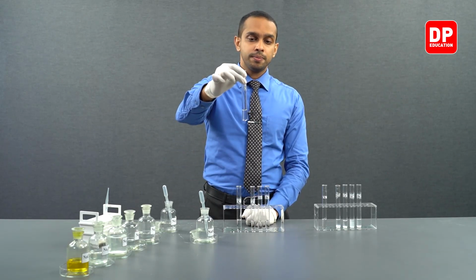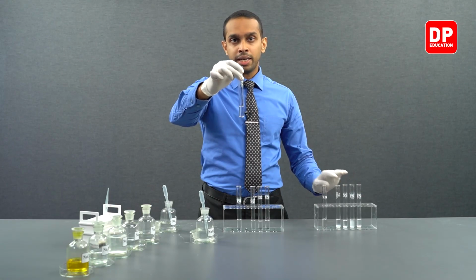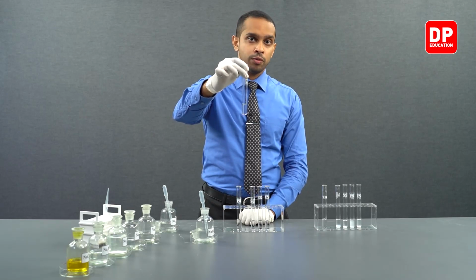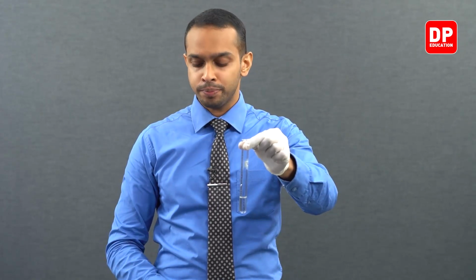Now let's take magnesium 2 plus aqueous ion solution. If you remember, just a little while back, when we added carbonate anions into magnesium 2 plus aqueous solution, a white color precipitate was formed. Let's observe what happens when we add bicarbonate anion solution here.